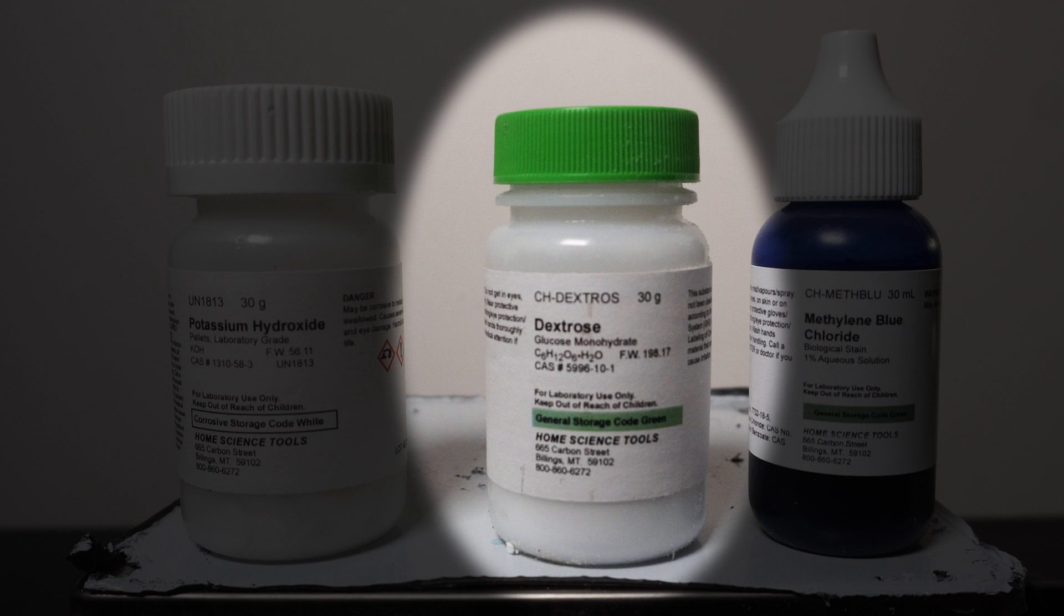Next, we'll need dextrose or glucose. Dextrose is just the dextro enantiomer of glucose, though commercially they are almost the exact same.